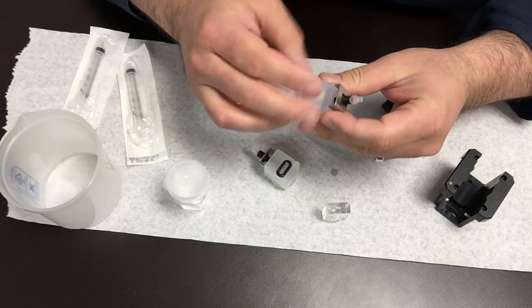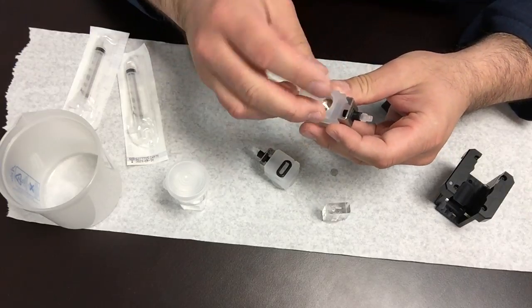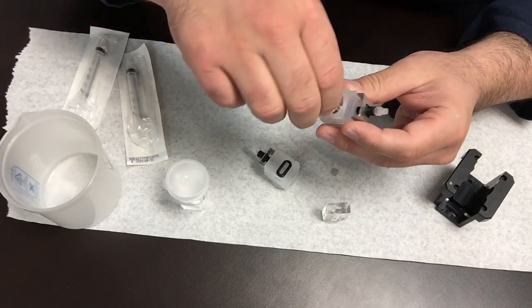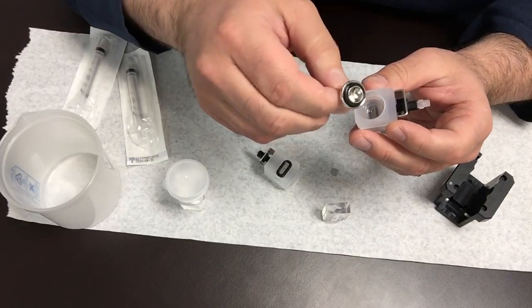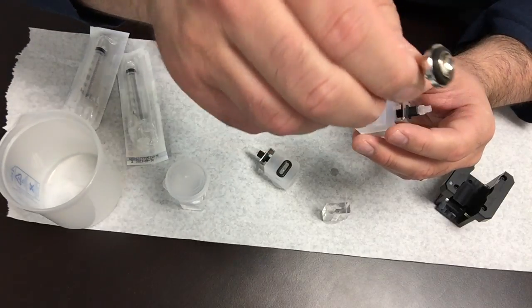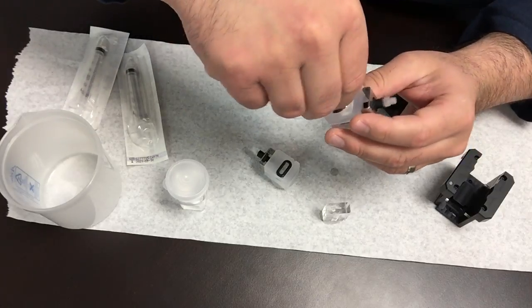These o-rings help to make the seal around the glass and around the electrodes. You unscrew the end and you have the curved shaped electrodes where you can see the o-ring is also on there to help seal things up.